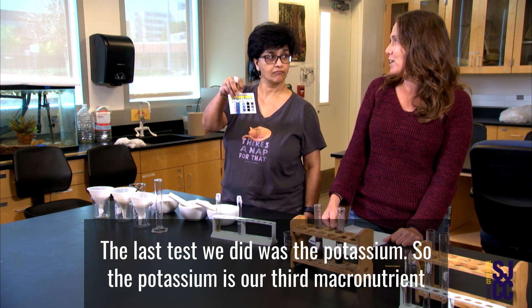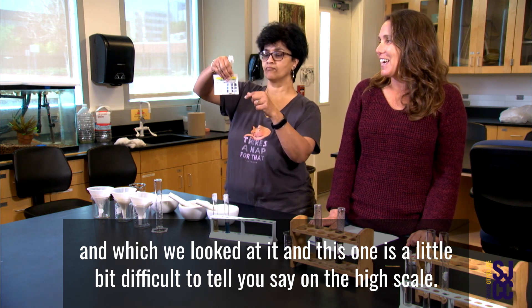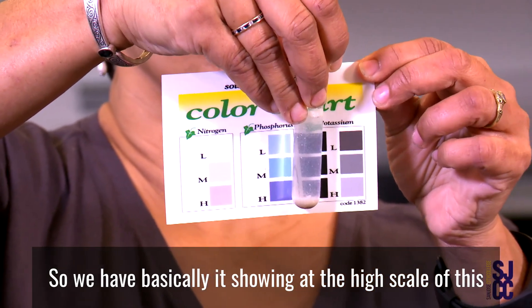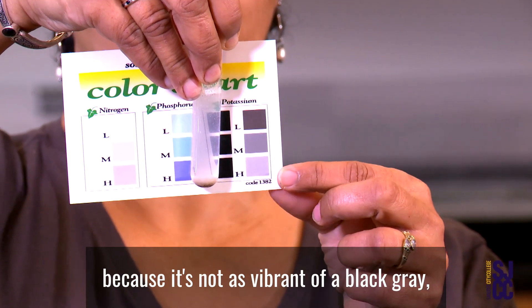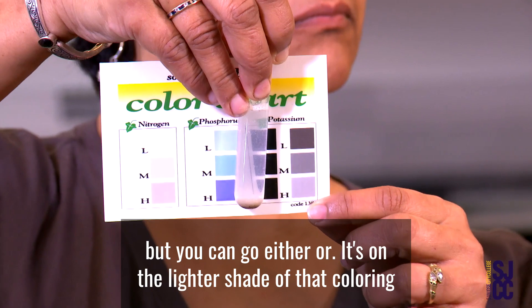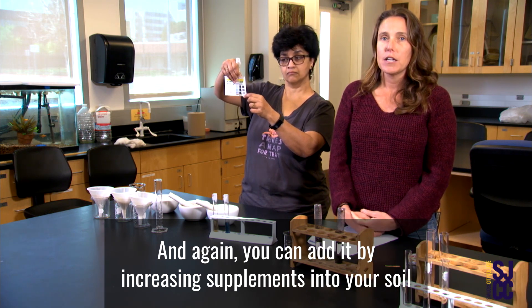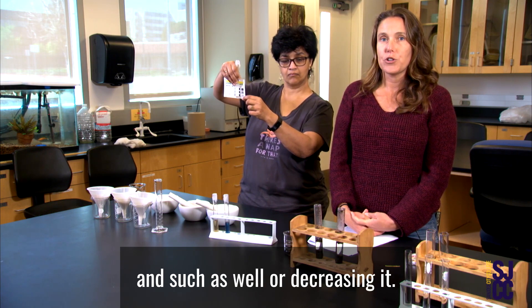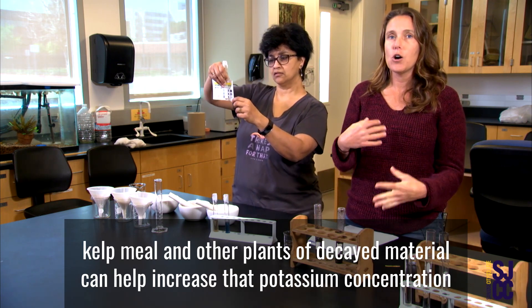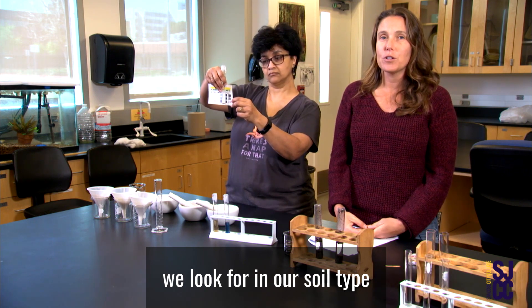The last test we did was potassium, our third macronutrient. This one is a little difficult to read, but it's showing on the high scale — it's not as vibrant a black-gray, but on the lighter shade of that coloring, so it could go either way. Potassium is another macronutrient needed for plant growth, and you can amend it by adding or decreasing supplements in your soil. Kelp meal and other decayed plant material can help increase potassium concentration as well. Those are our three macronutrients that we look for in our soil analysis.